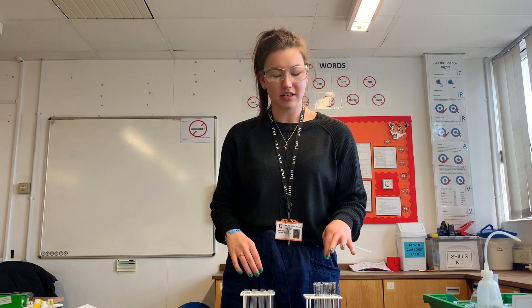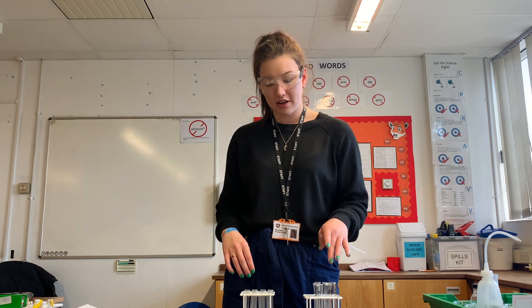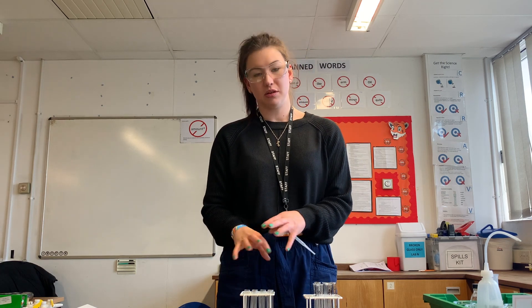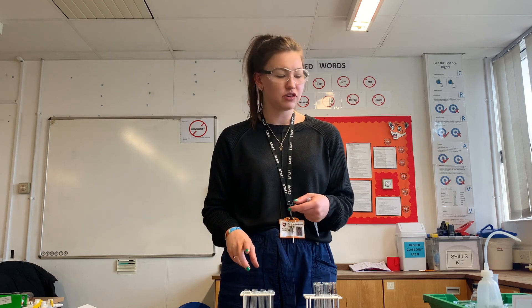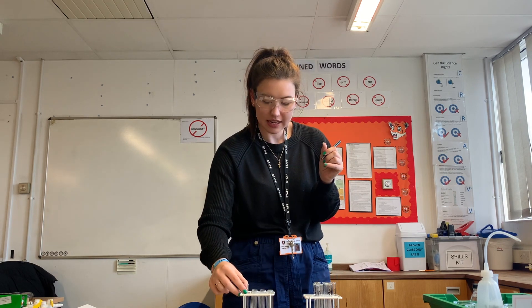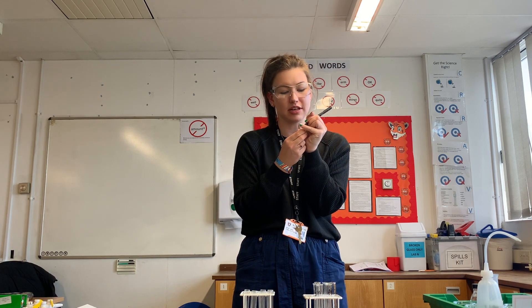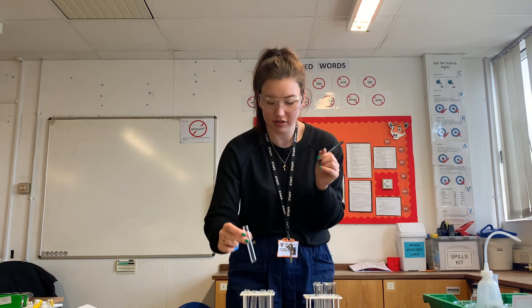Now that these are cooled, the next instruction is to pop two centimeters cubed of each solution into some centrifuge tubes. I'm going to label my centrifuge tubes to make sure I don't get confused. If you're doing this in a class, I would suggest putting your initials on the centrifuge tubes so nobody gets confused.